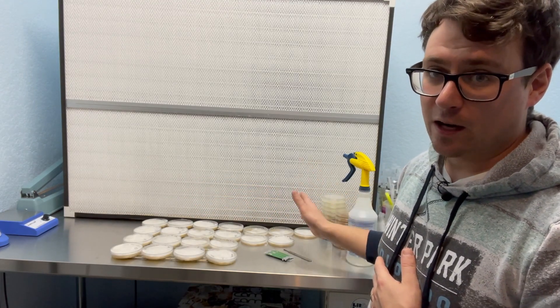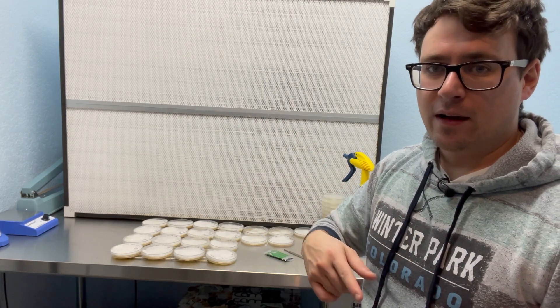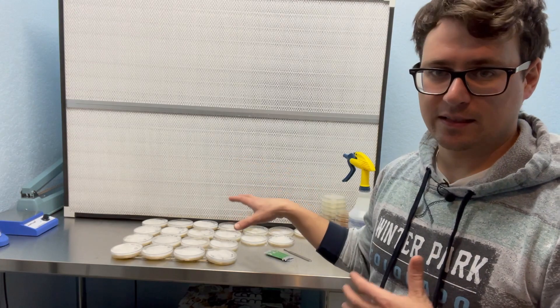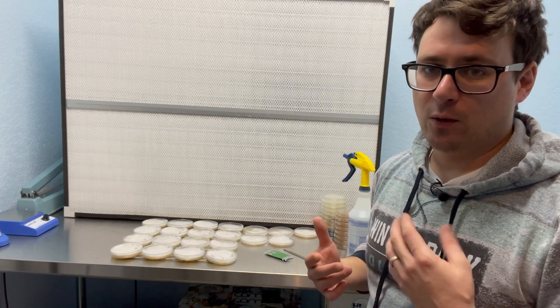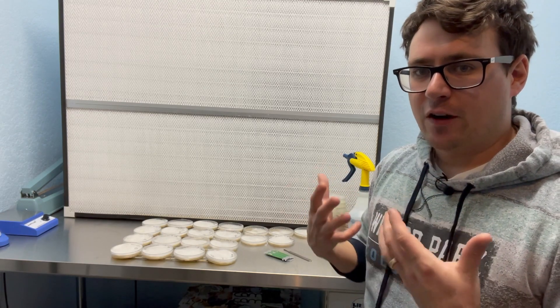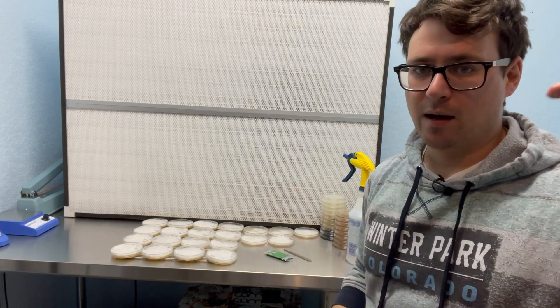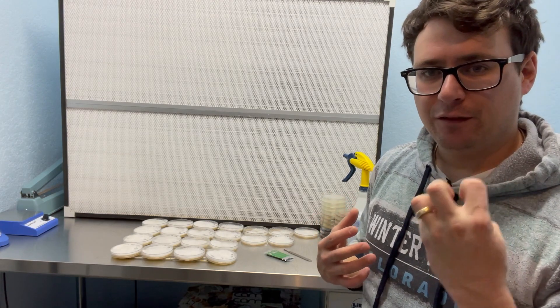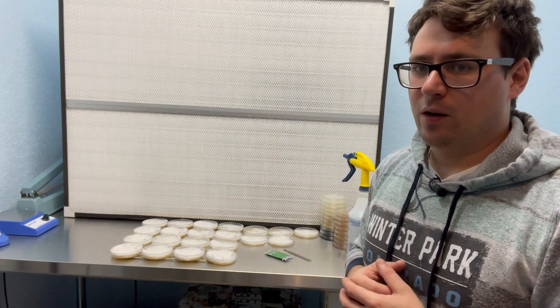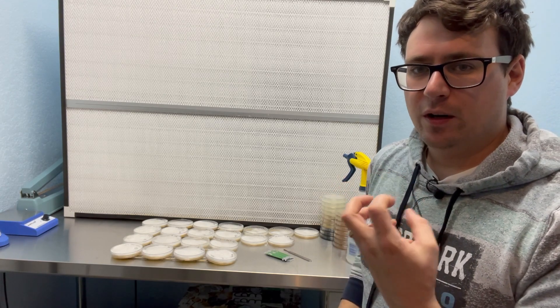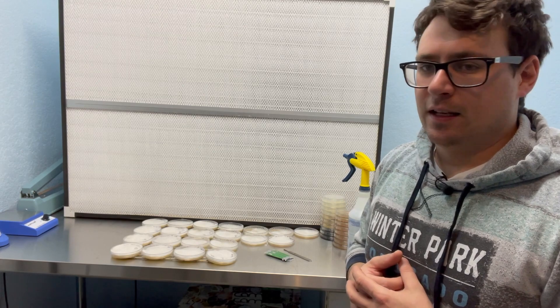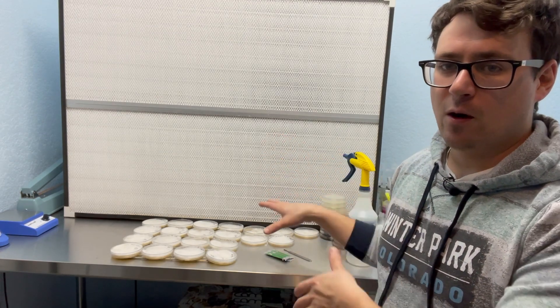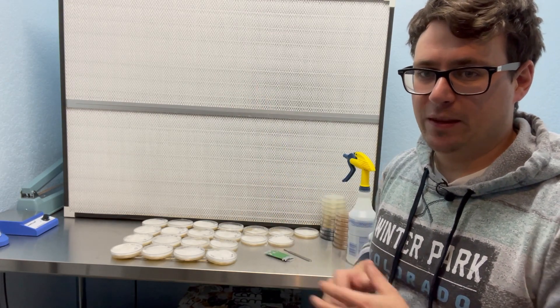And then I'm going to flip the camera around and go through my transfers onto fresh agar petri dishes. Once those grow out they will go out onto grain and then we'll follow up with the fruiting. Hopefully in the early spring we'll get to select the strongest oyster mushroom. I'm really looking for a bright white oyster with some fragrance to it. So this Colorado strain is really nice because it tolerates pretty high and low temperatures, it's very versatile. However, it doesn't have that really fluffy bite that the commercial blue oyster or the king oyster from Mossy Creek Mushrooms. I'm looking for that really thick smokiness flavor almost.